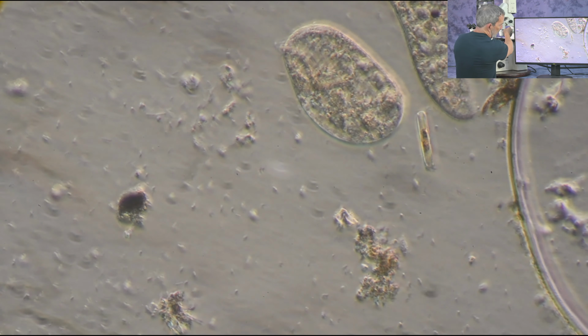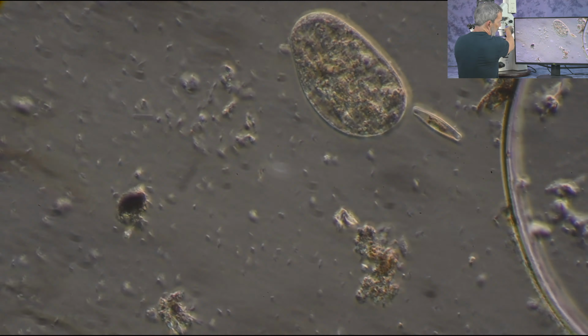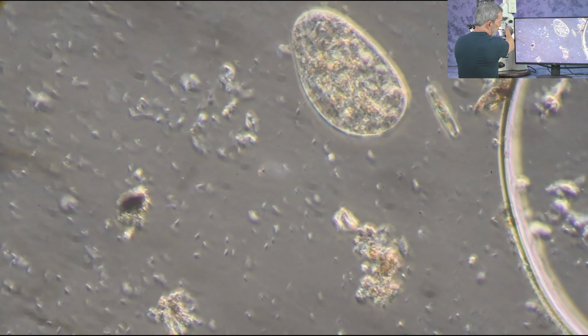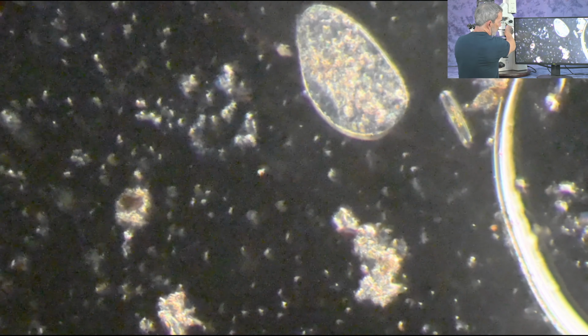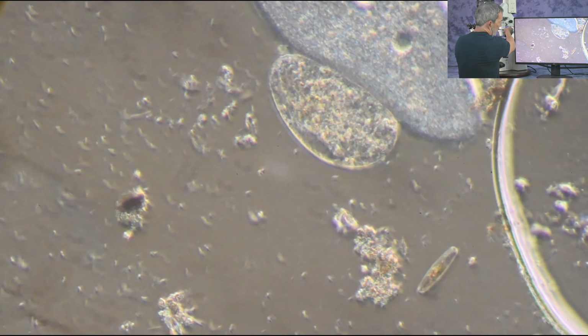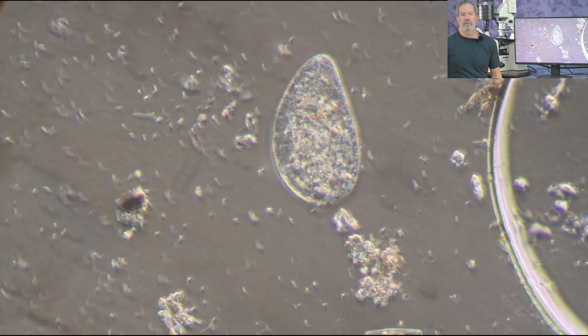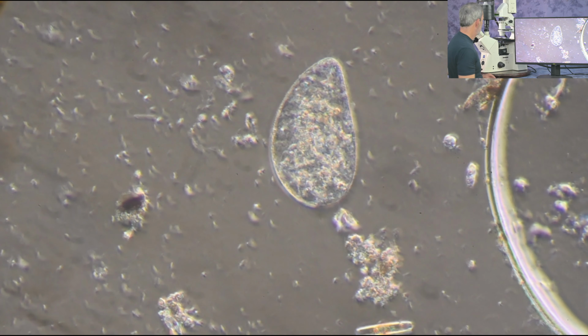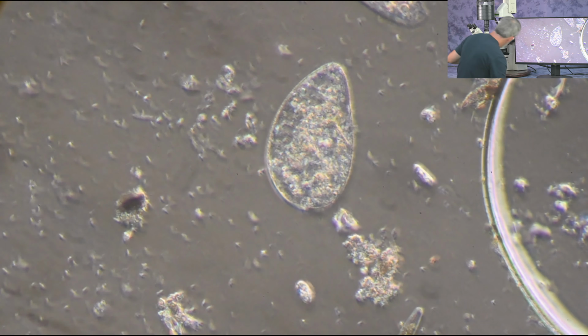So there again, I do get some relief pattern out of this, depending on the setting of the VAR. And you can see it can also go into the pseudo dark field. So depending on what you're really trying to image, the VAR can be helpful to you. That is the LD A plan 40X, and it's rated for the 1 millimeter thick Petri.